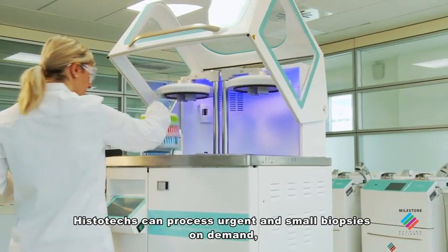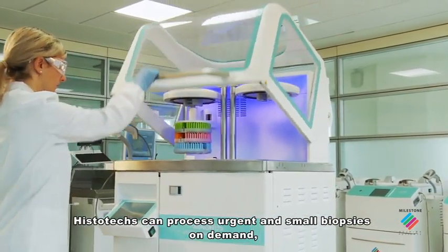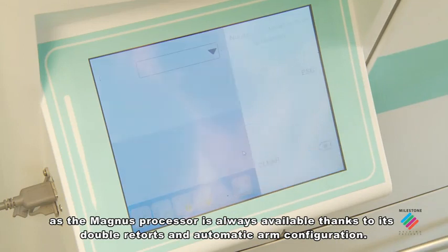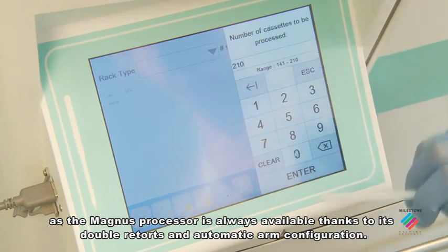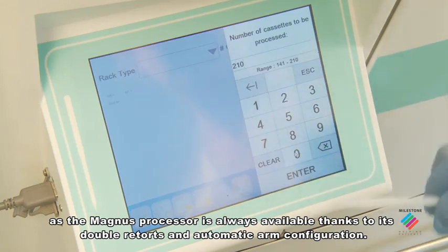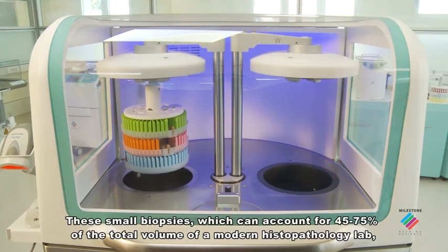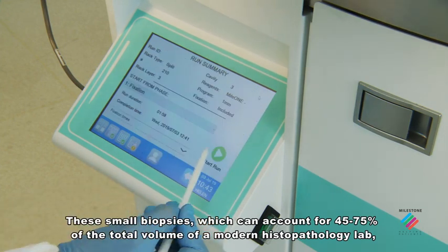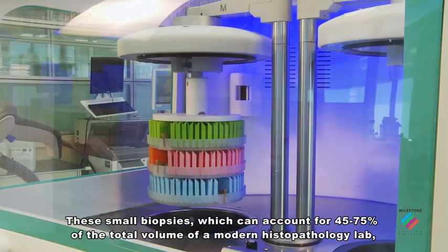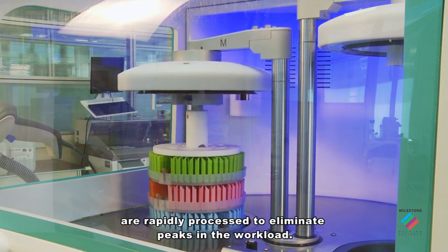Histotechs can process urgent and small biopsies on demand, as the Magnus processor is always available thanks to its double retorts and automatic arm configuration. These small biopsies, which can account for 45 to 75 percent of the total volume of a modern histopathology lab, are rapidly processed to eliminate peaks in the workload.